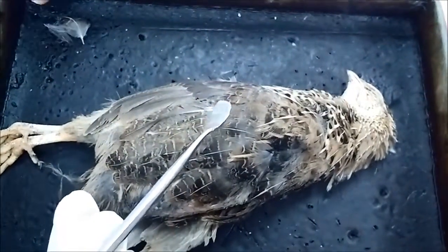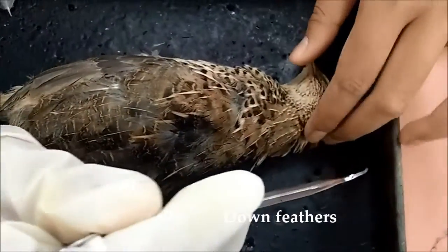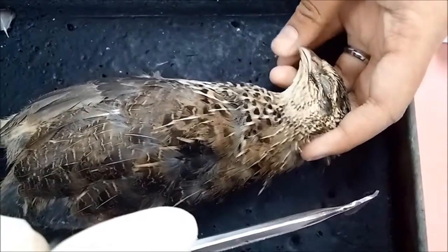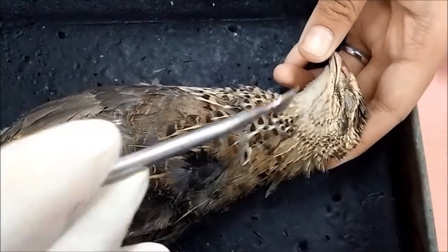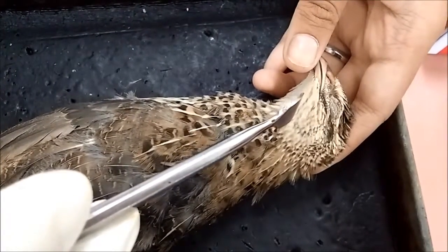And then we go to the down feathers, also known as plumose. Basically, we can chiefly find them in chicks and water birds, but some are found beneath the contour feathers in the adult. The calamus is extremely short and the barbs arise from it. They are generally small with a weak, soft shaft and soft vane, and lie close to the skin.